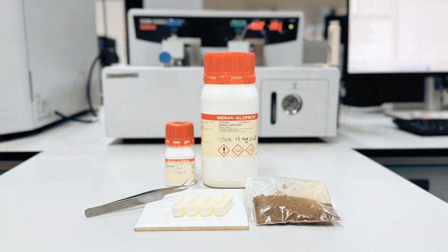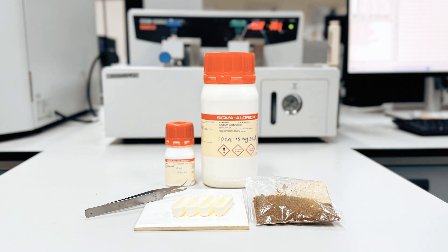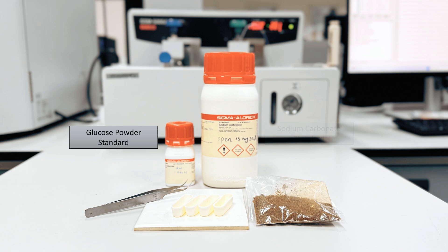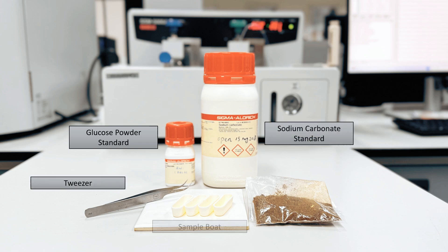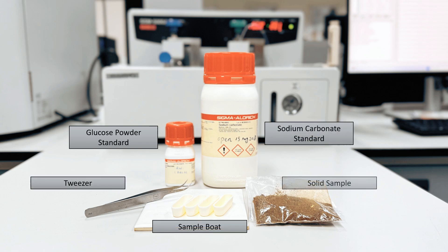To measure solid sample TOC, there are a few things you need to prepare: glucose powder standard, sodium carbonate, tweezers, a sample boat, and a solid sample.